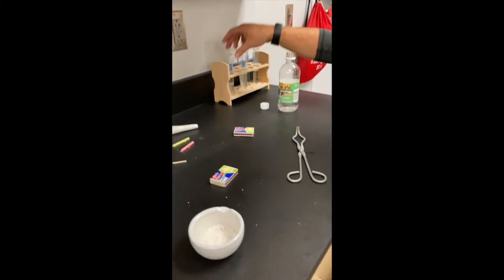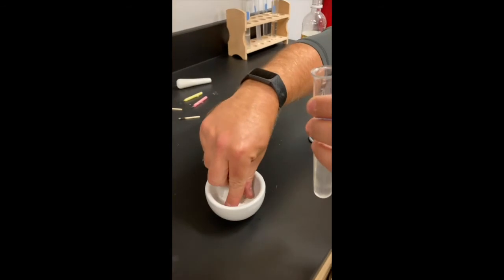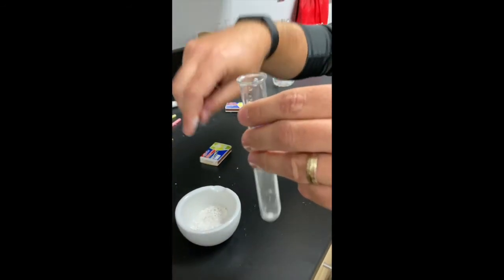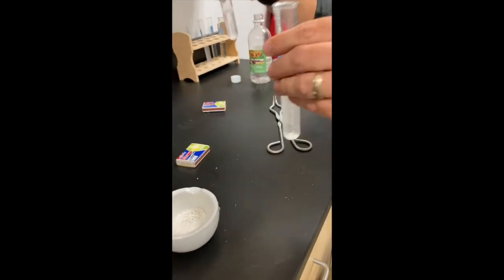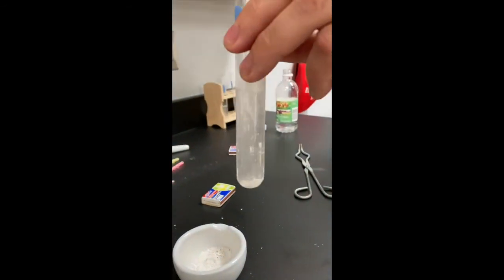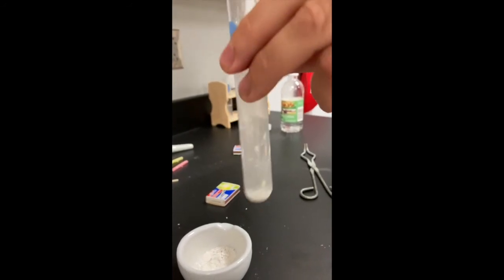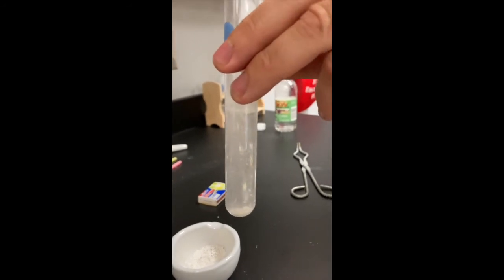Now I'm going to take number 6, and I'm taking the chalk that I just crushed, and I'm mixing it with water. And I'm going to shake it up. And here's the vinegar one, but here's the water one. And we're going to look at it, and I want you to decide physical change or chemical change. And again, evidence for it.